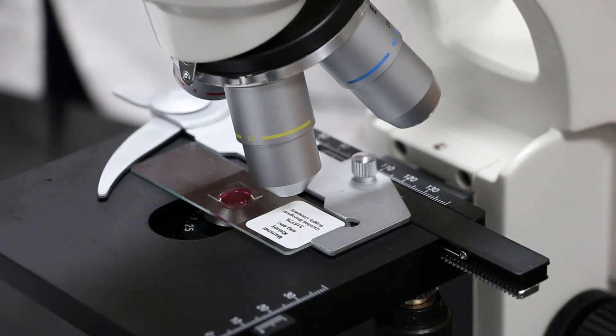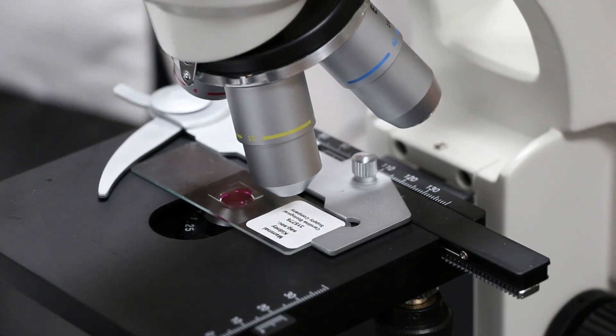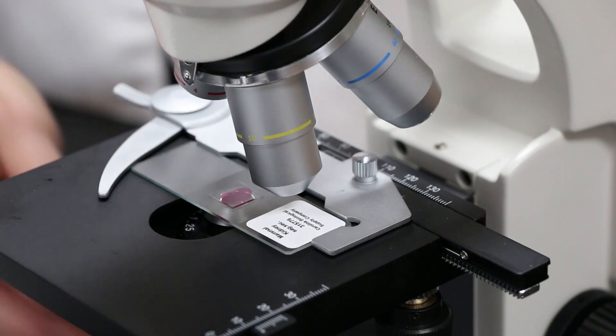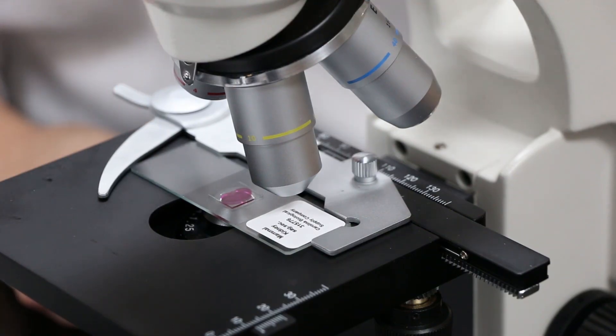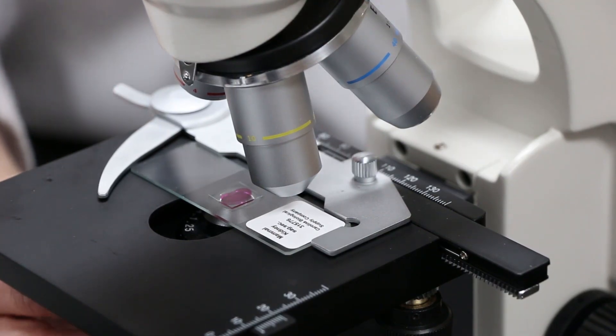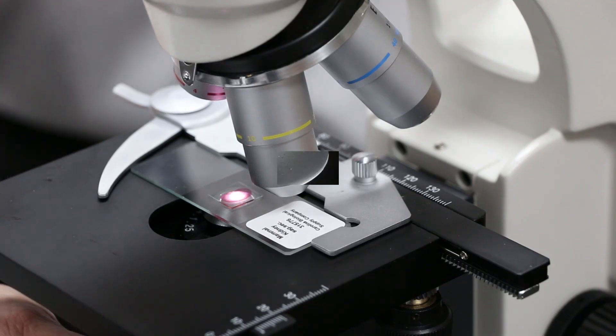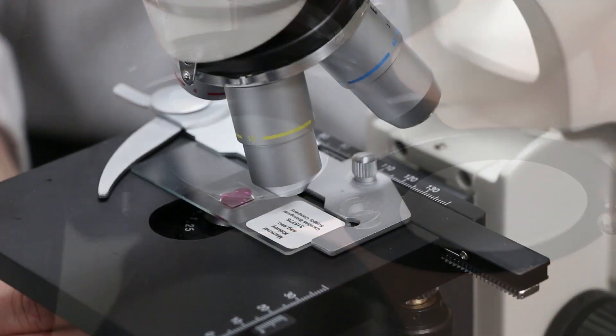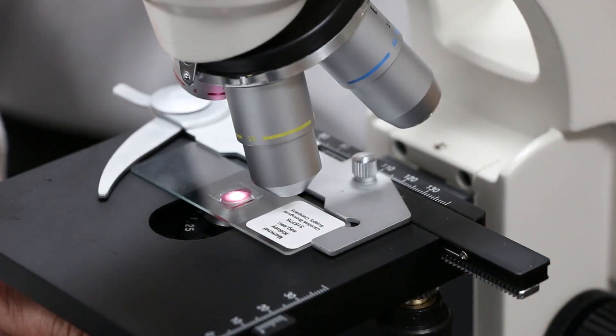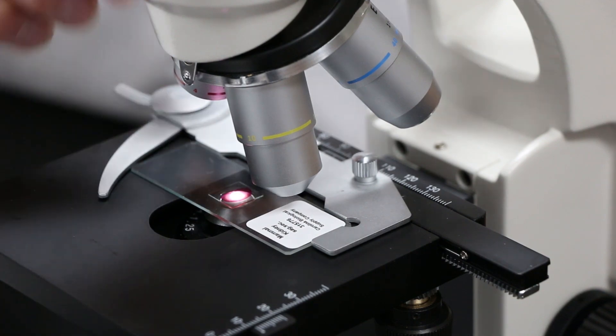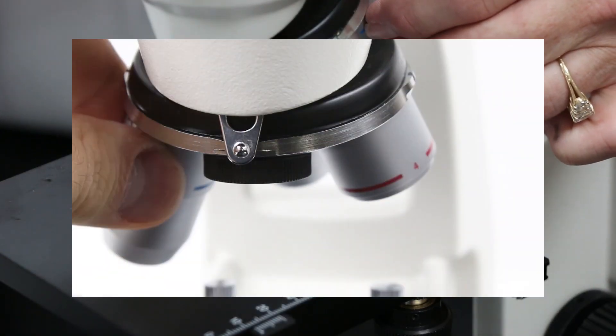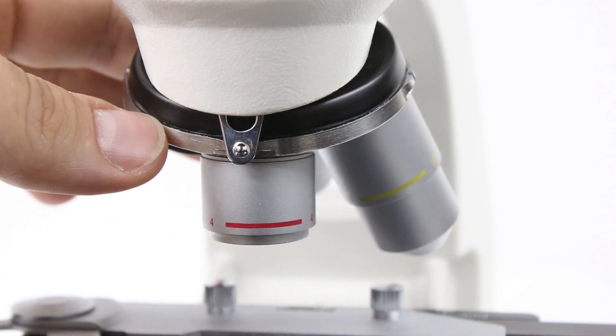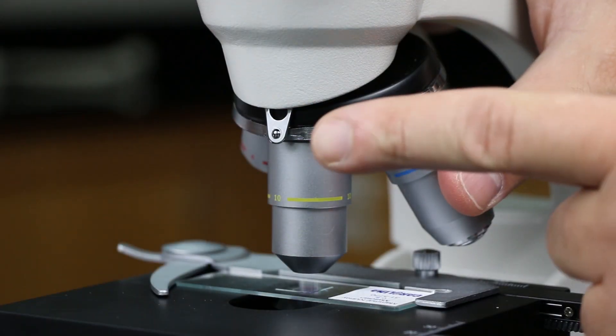A lot of times a student will think that the microscope is not working. And I'm going to answer some questions that are frequently asked. One of them is the light is on here and my illuminator, but I don't have any light coming through to my eye, so I can't see anything in the microscope. One thing that might be wrong is that the iris diaphragm is closed all the way. And you can see that there's no light coming through when the iris diaphragm is closed. So that's one thing that could be wrong. One other thing is if the nose piece is not clicked into place with the objective, then again no light will come through if it's in between two objectives. So you have to make sure that you hear that click when you turn the revolving nose piece.